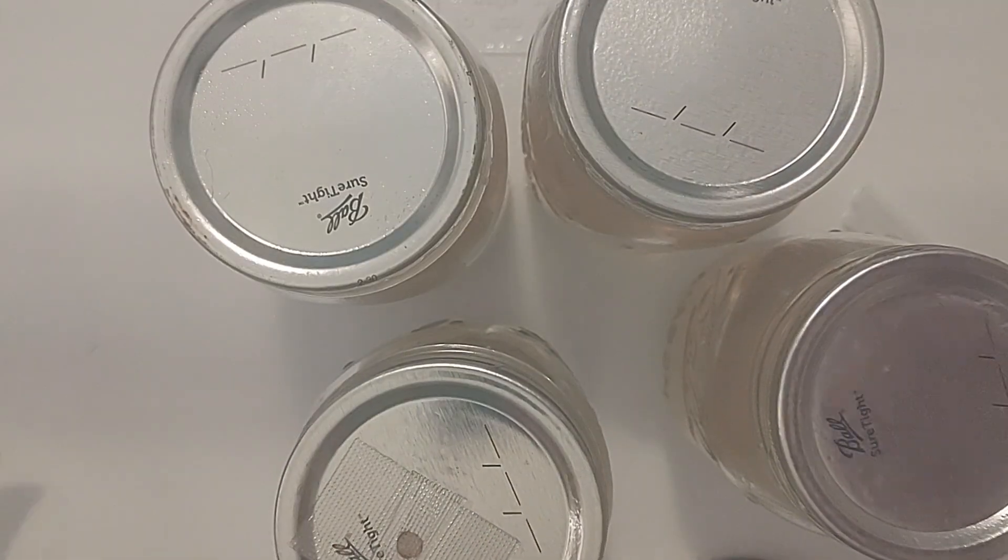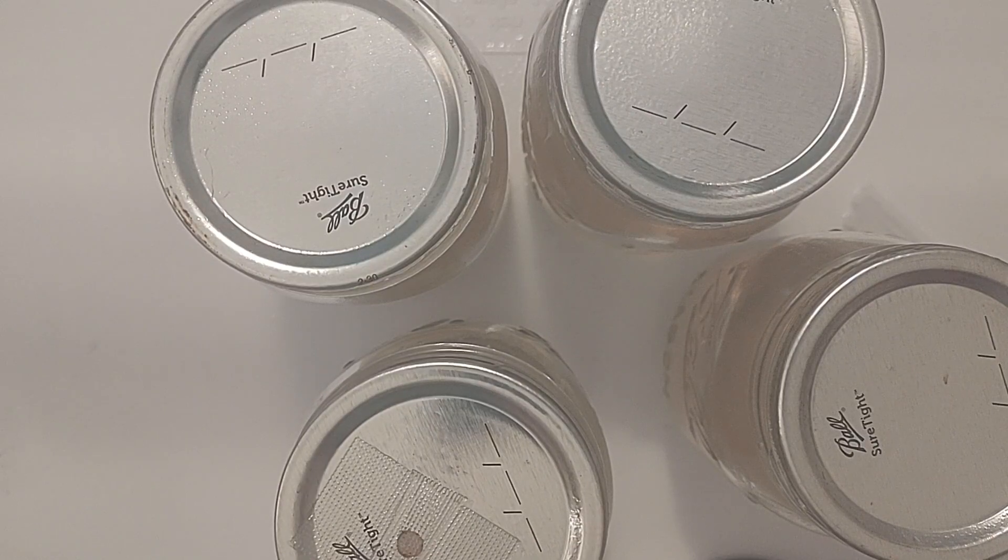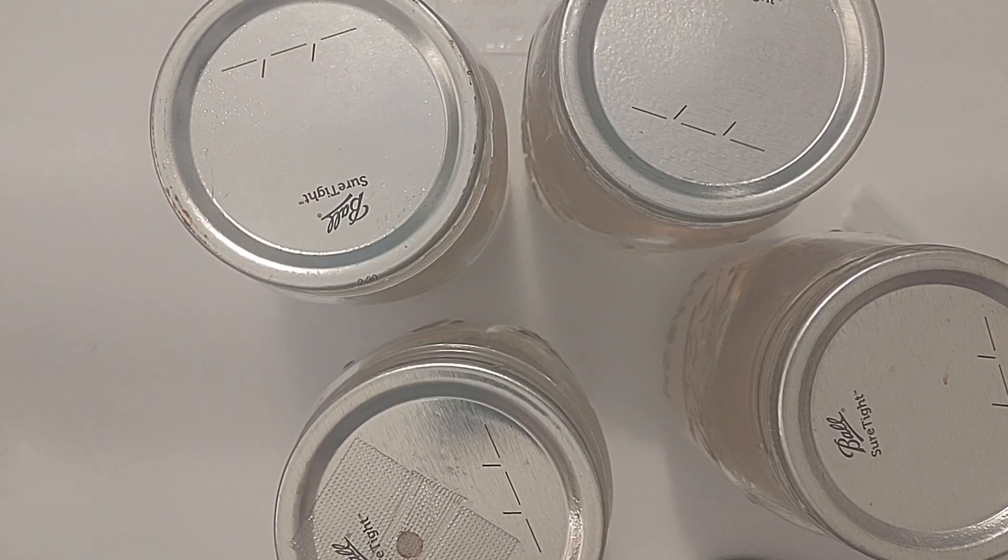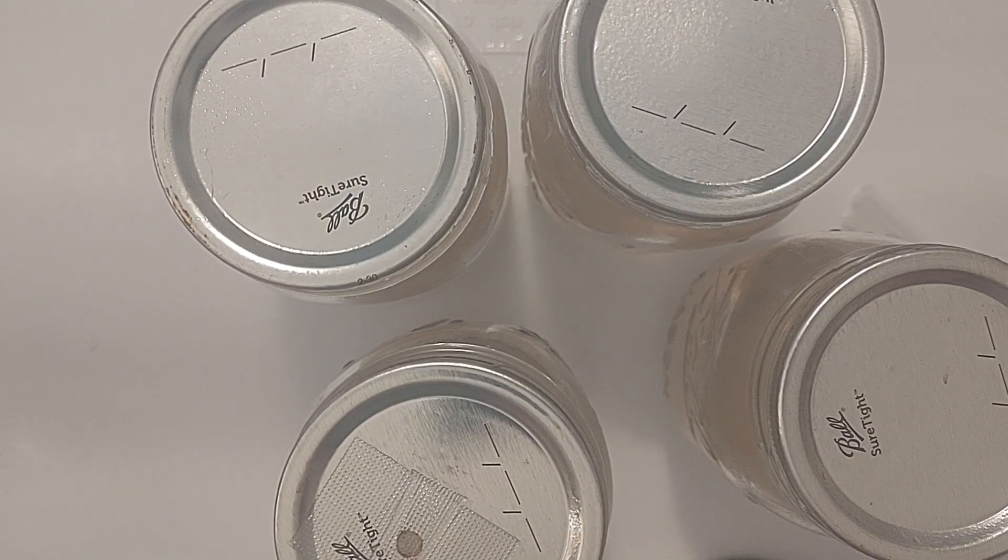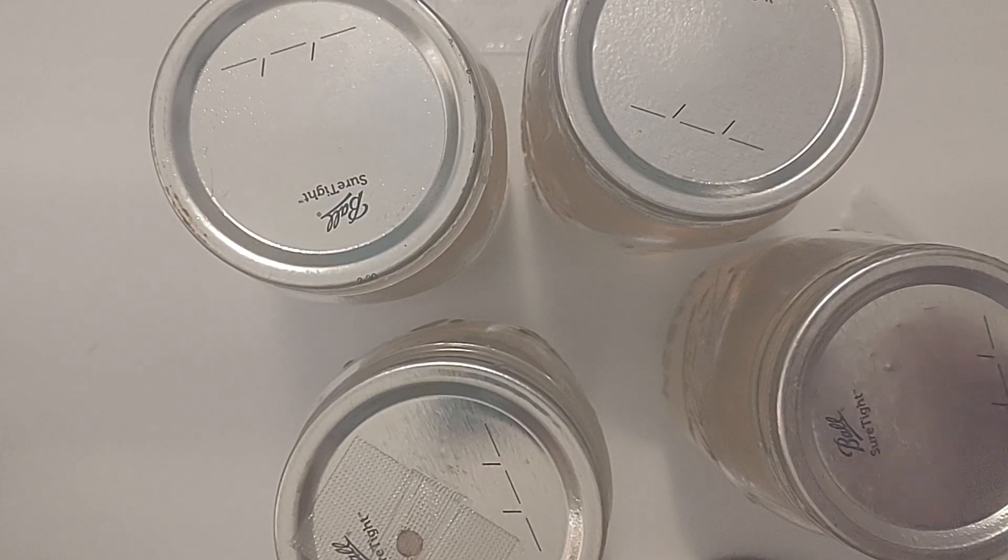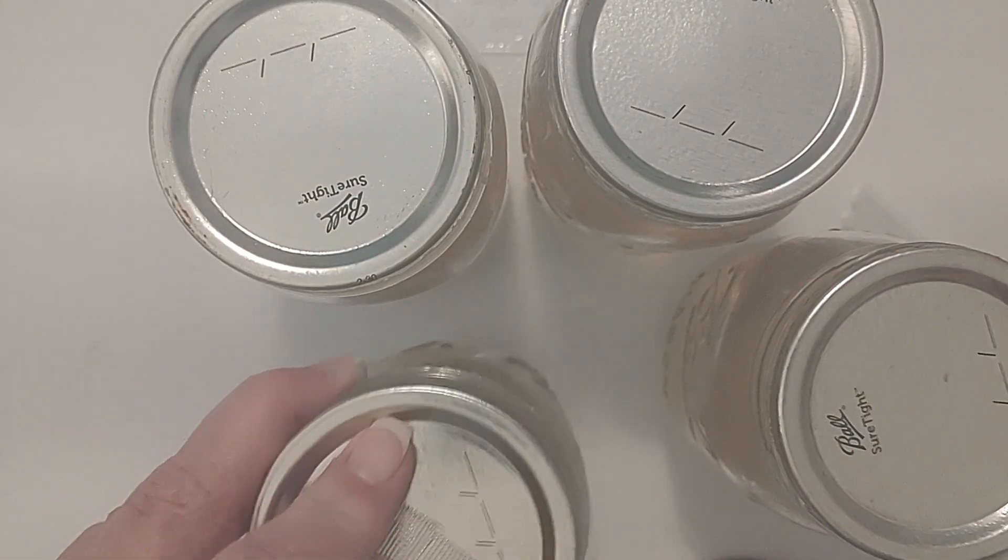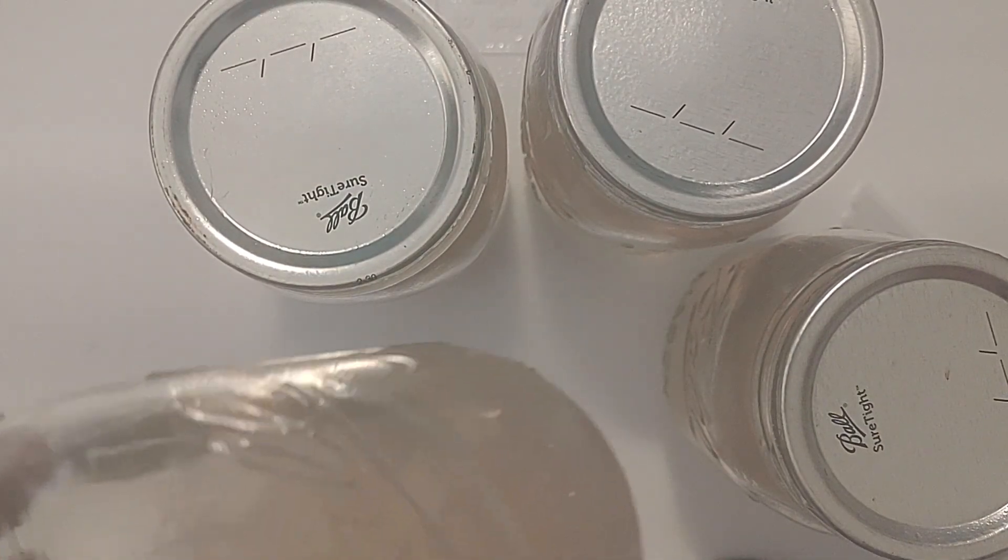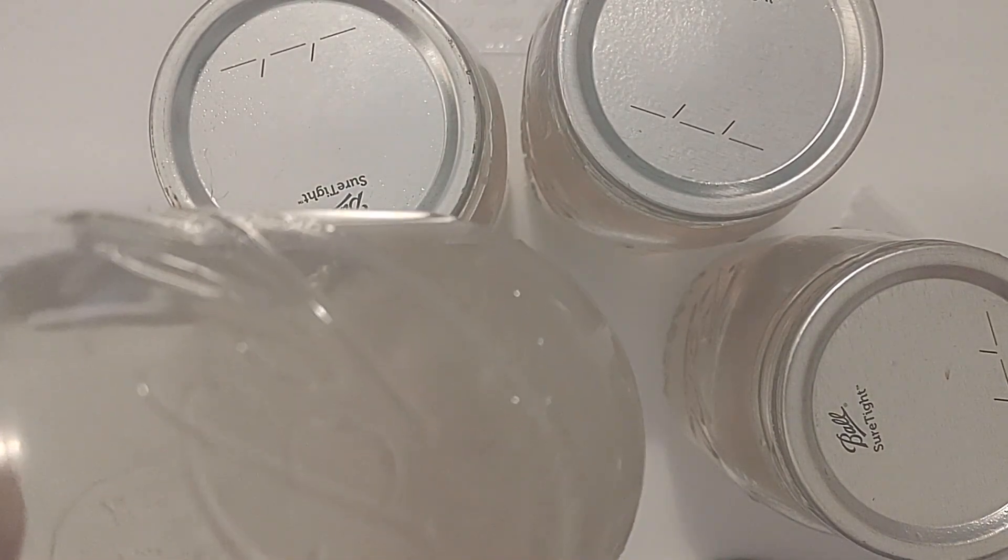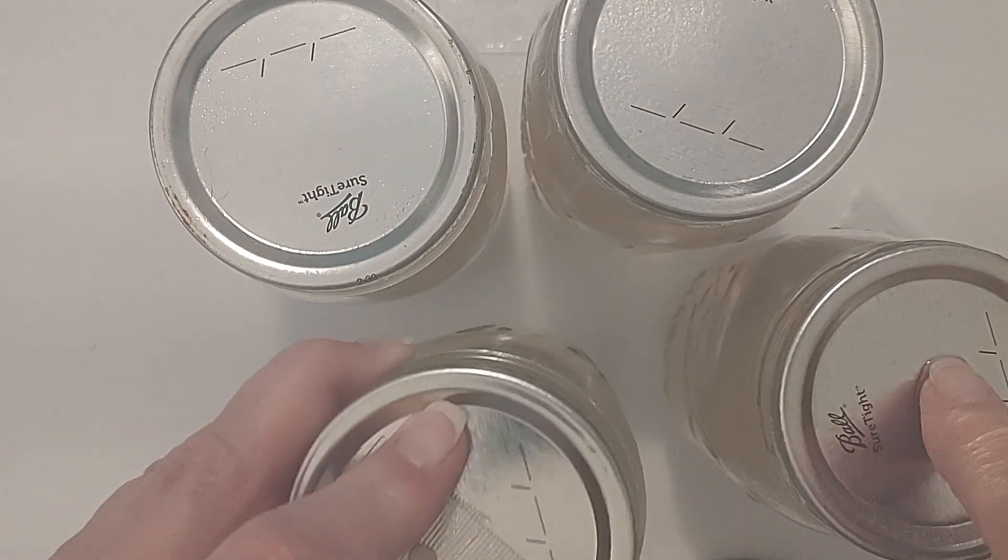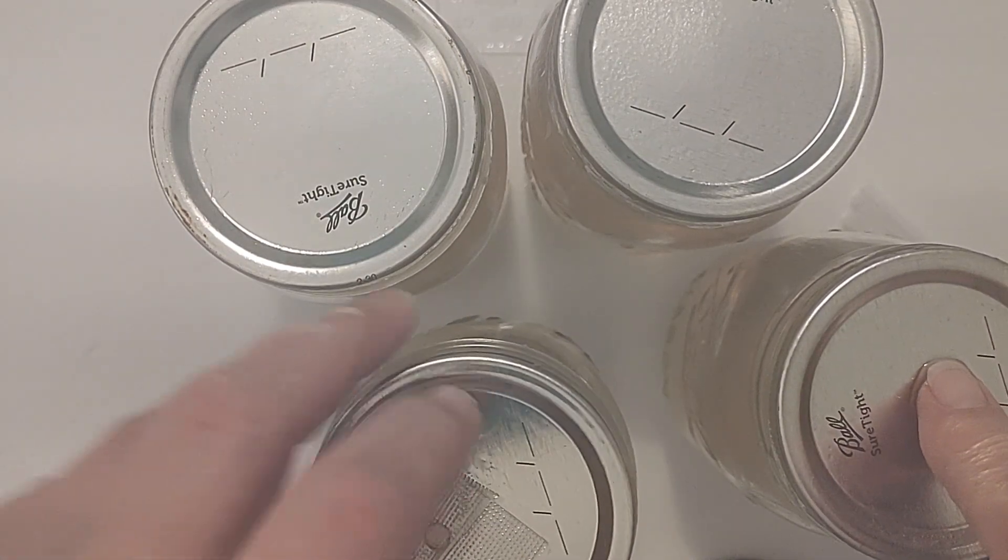So we use these disposable syringes that we don't have to worry about any kind of contamination. And next I'm going to move the slurry over to this liquid culture.